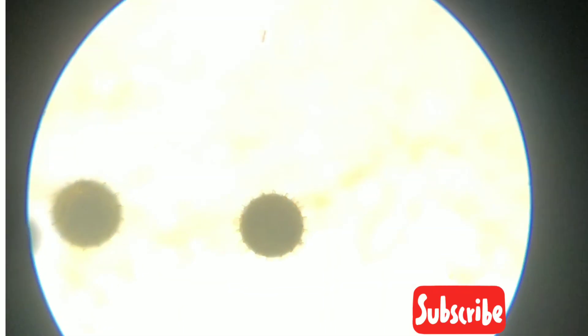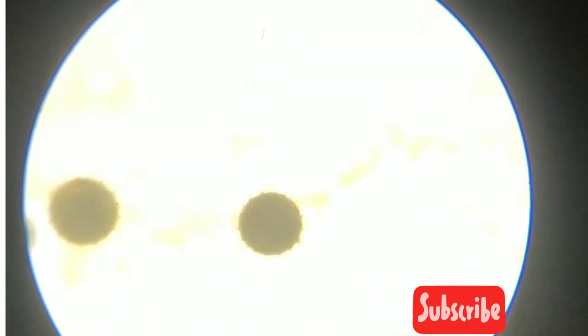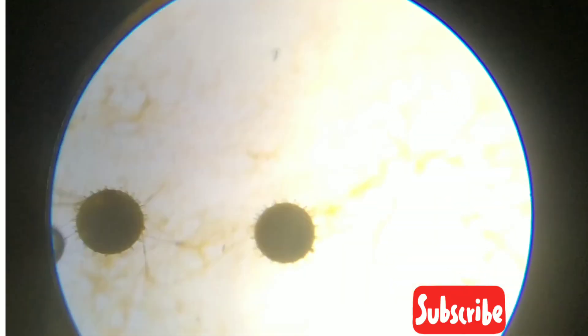As you can observe under the microscope, these are the pollen grains of the hibiscus flower.